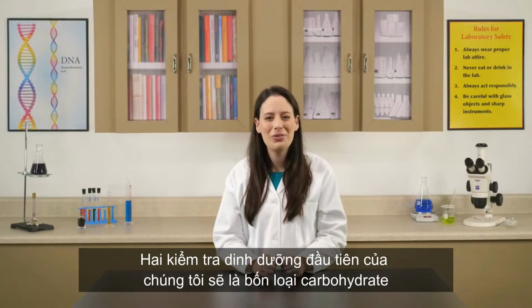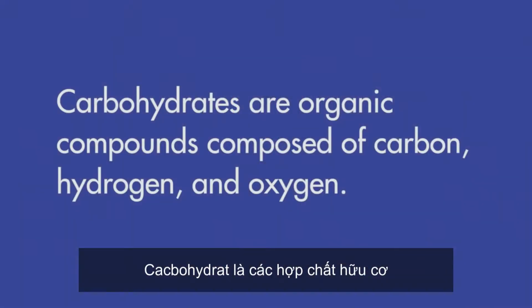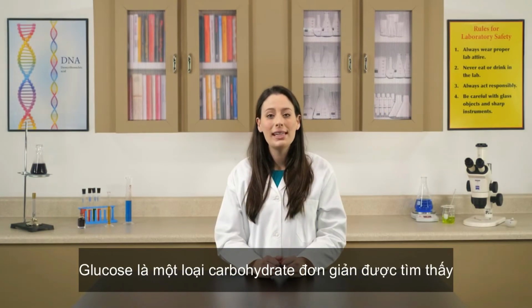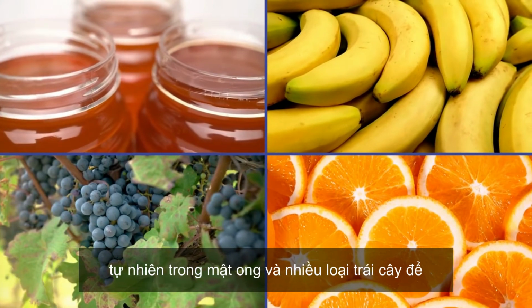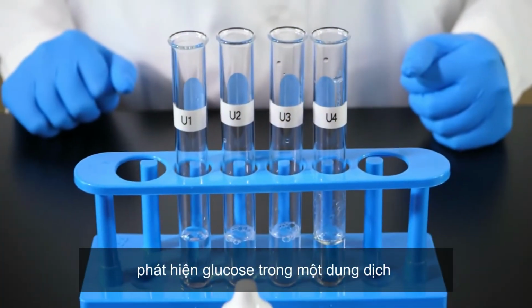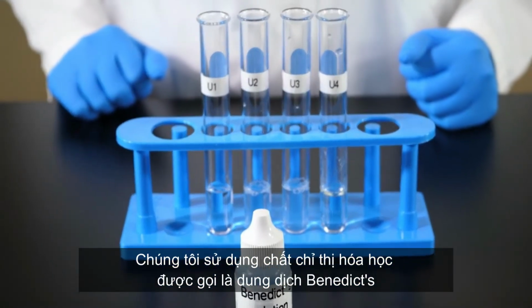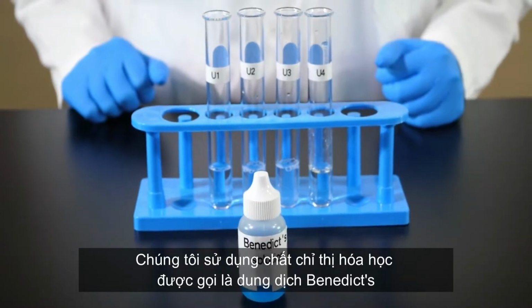Our first 2 nutrient tests will be for carbohydrates. Carbohydrates are organic compounds composed of carbon, hydrogen, and oxygen. Glucose is a simple carbohydrate found naturally in honey and many fruits. To detect glucose in a solution, we use a chemical indicator called Benedict's solution.